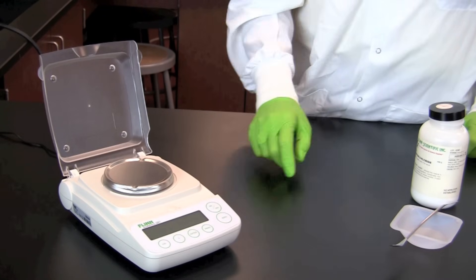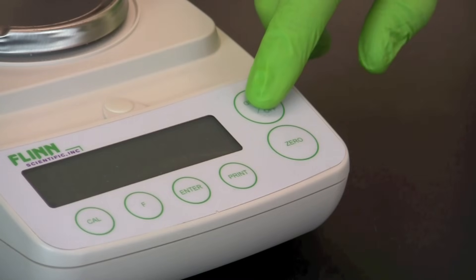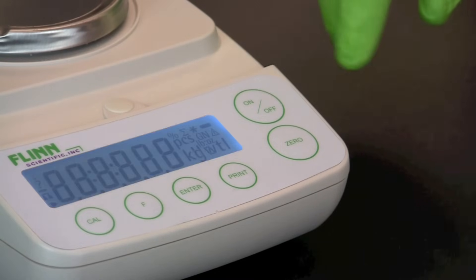To start using an electronic balance, first turn on the power button. The balance will zero itself.